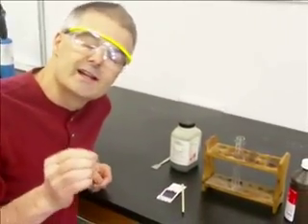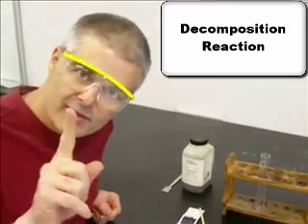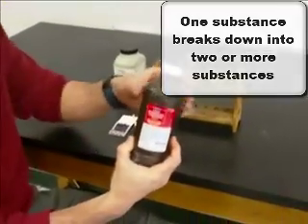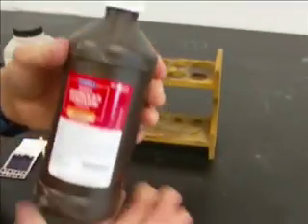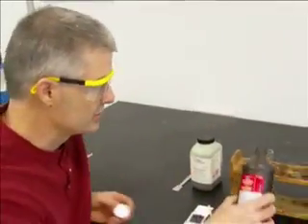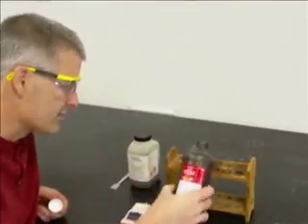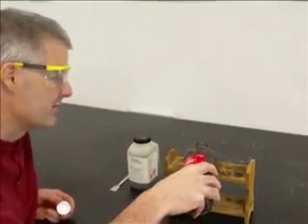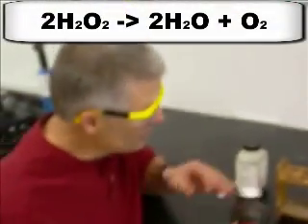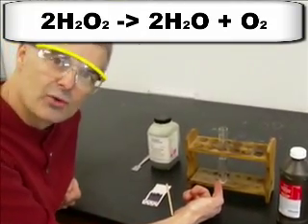All right, I want to show you today a decomposition reaction. Now remember, in a decomposition reaction, you start with one thing, it breaks apart into multiple things. The chemical I brought with me today is hydrogen peroxide. This is the stuff that you can just buy at City Market or King Soopers or whatever your local grocery store is. I'm going to pour that into a test tube. Hydrogen peroxide by itself decomposes into water and oxygen gas. So it's actually decomposing right now, but it's a very, very slow reaction.